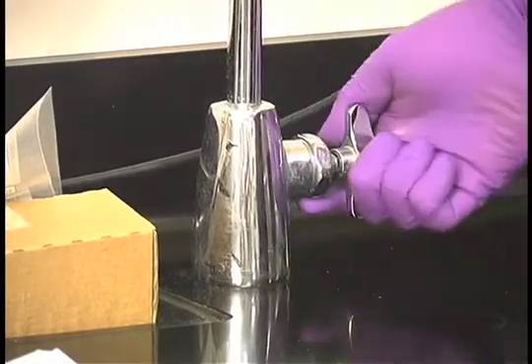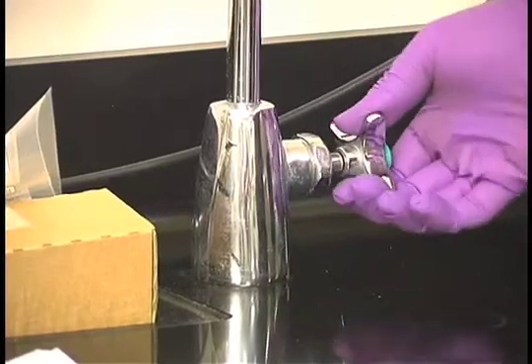We then need to turn on the vacuum. We open up our aspirator so it is fully open.